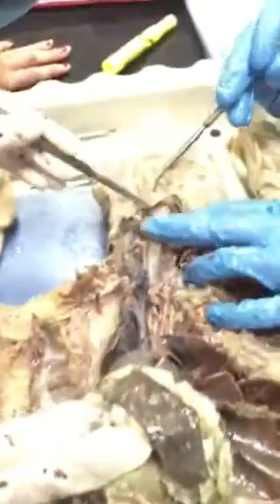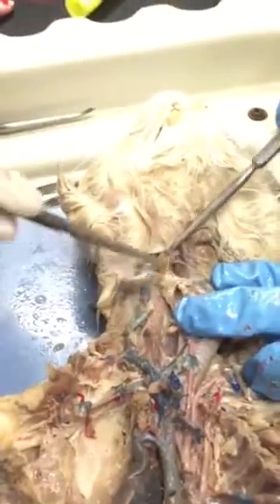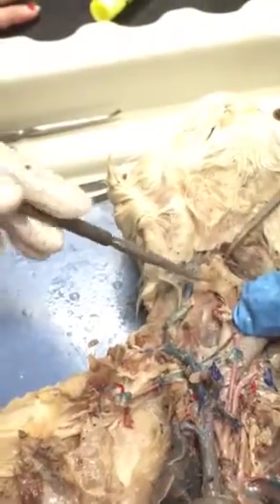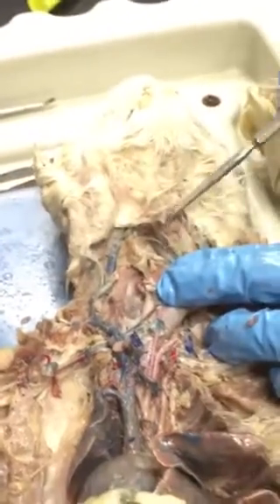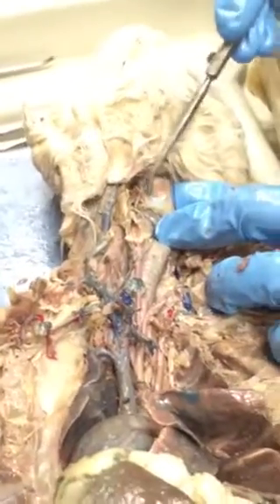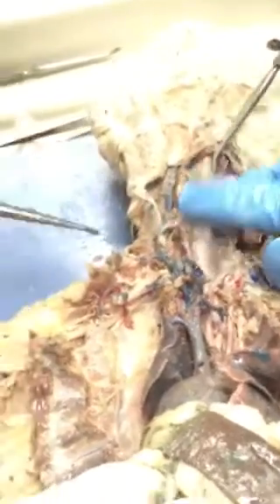Did you find the thyroid up here? Which is right here. Some of this is muscle, but yeah, that's probably thyroid. The tissue starts looking all the same. That's muscle. The thyroid's going to be right up against the trachea. Look, it even shows you where it was supposed to be in the front of it, those little bulbs, because it's on the other side too. Yeah, those are both thyroid.